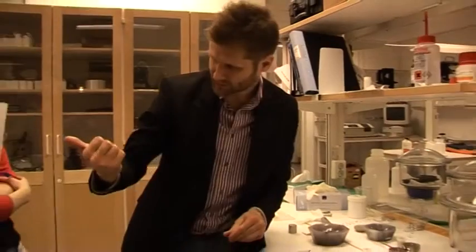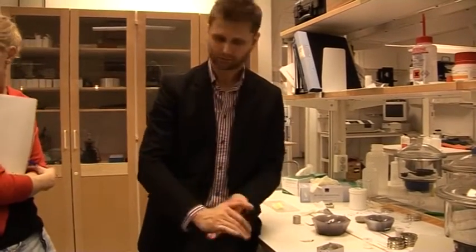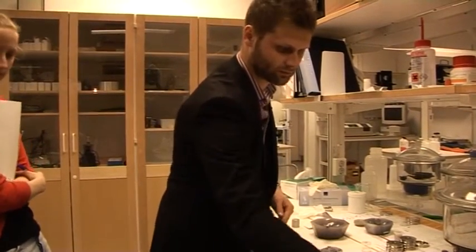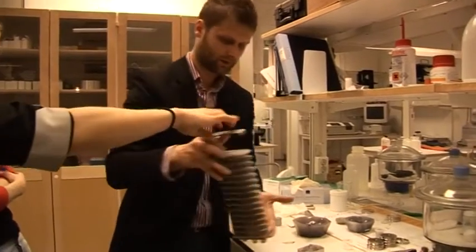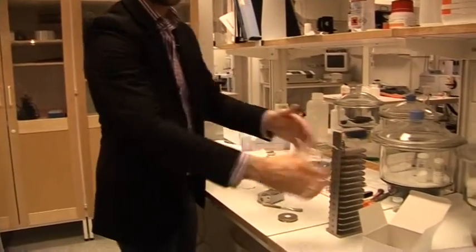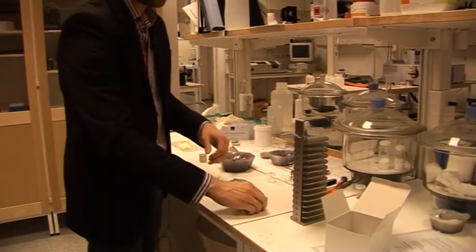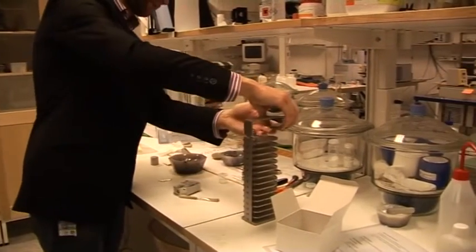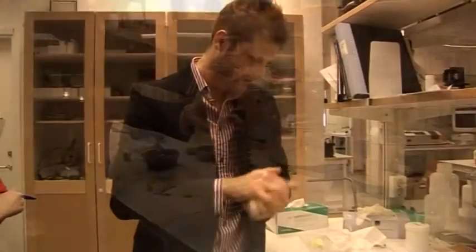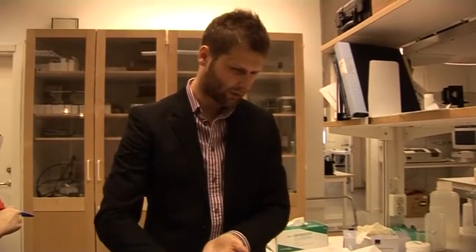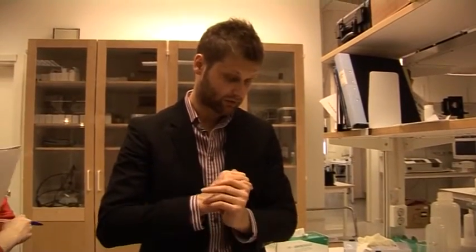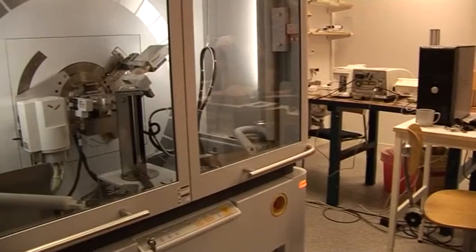So then you see here we can put up to 15 samples in this sample changer. We just put this one in the first position. I think all the samples are now ready, so someone can put it in.